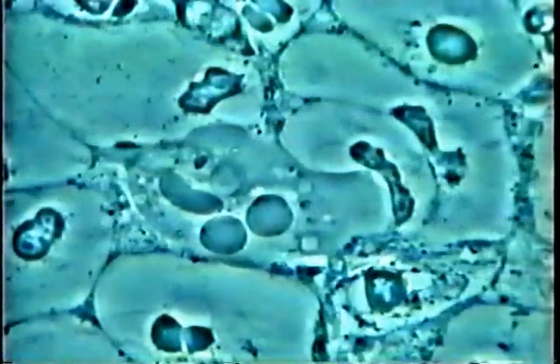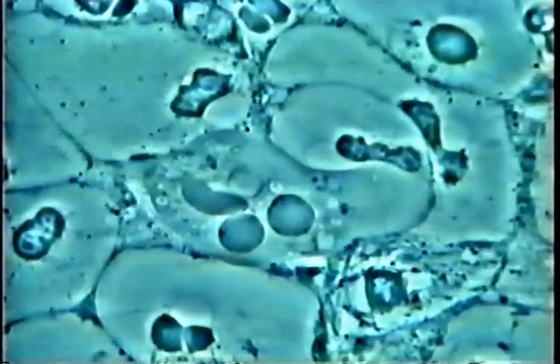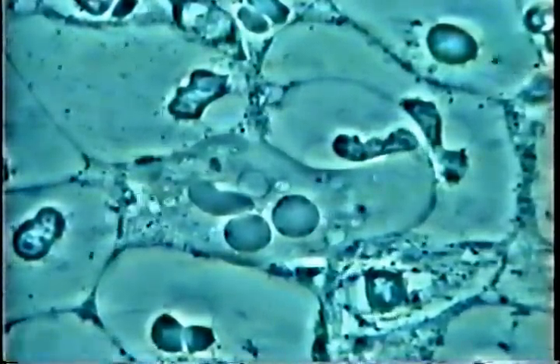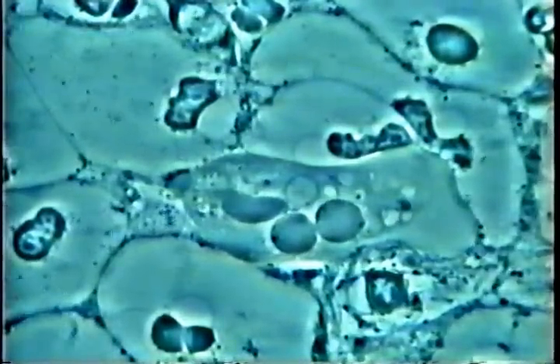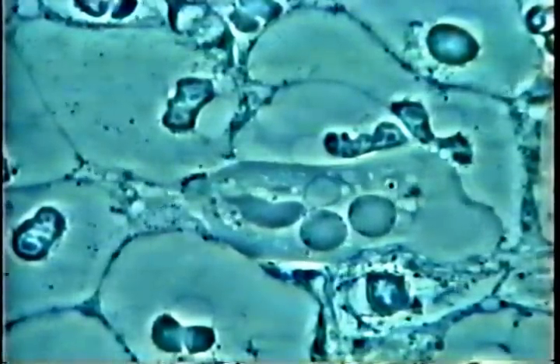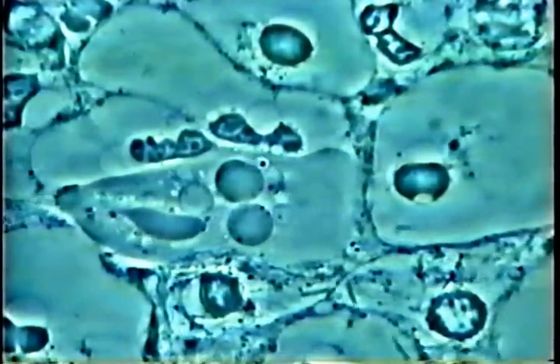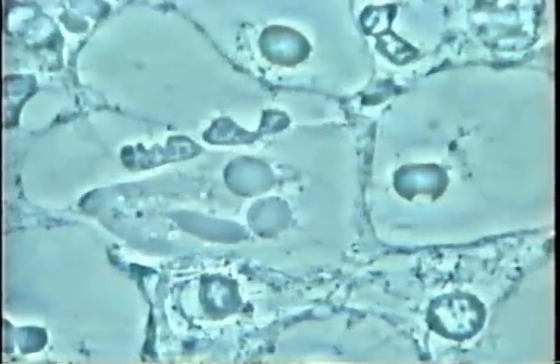Many things can be done to get rid of those parasites, but they must go away if you want to cure the disease. We see small spirochetes here, and then the amoeba moves away to find another white cell to feed on. This process goes on and on until you act and do something with your dentist. We consider the microscope very diagnostic in this disease, to make sure you get rid of those animal parasites in the sulcus of your gum.